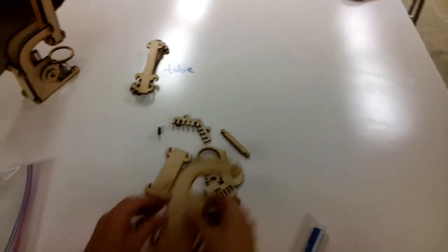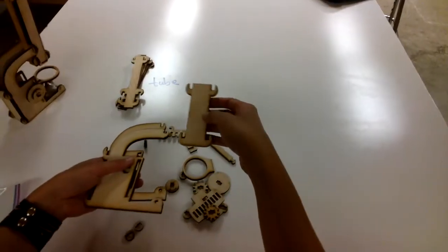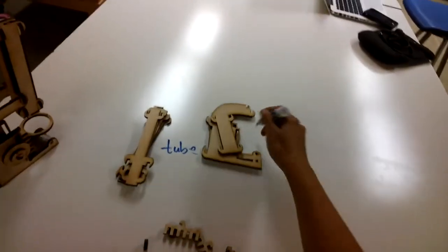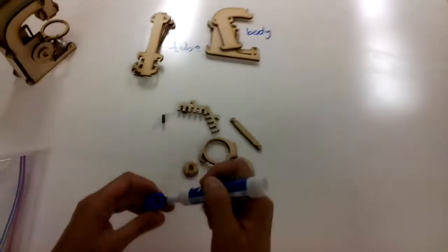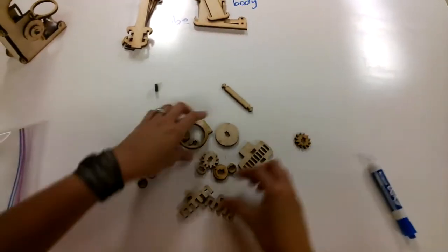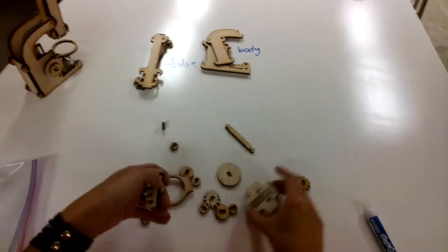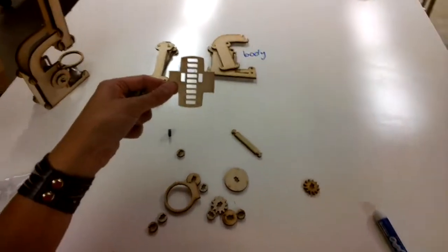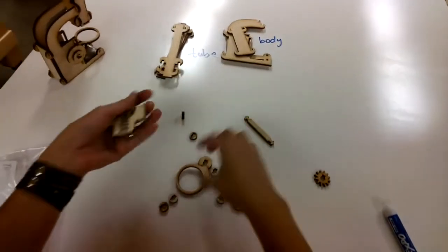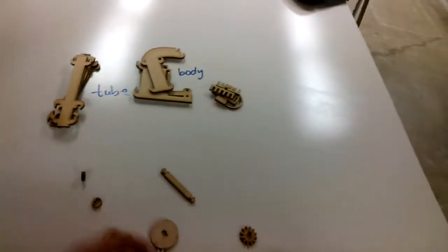Now look for 2 big pieces, as well as this piece that looks like a rectangle with little hooks on it. These 3 pieces are for the body of your microscope. Okay, now we're going to look for the parts for the stage. So you need 2 of these kind of comb-like pieces, 1 piece with all these notches in the middle, and then the big ring. These 4 pieces make up the stage of your microscope.